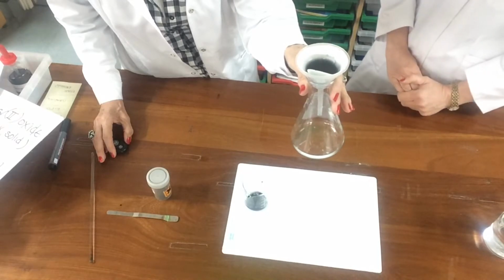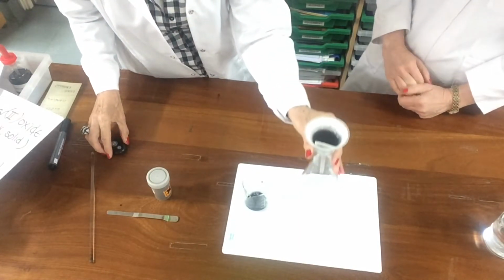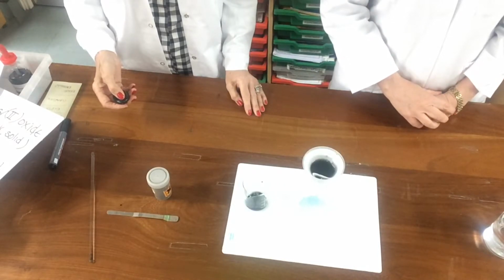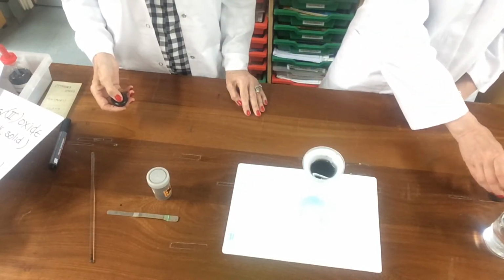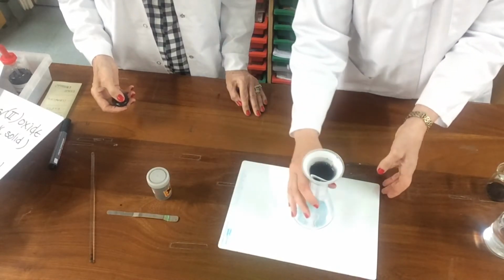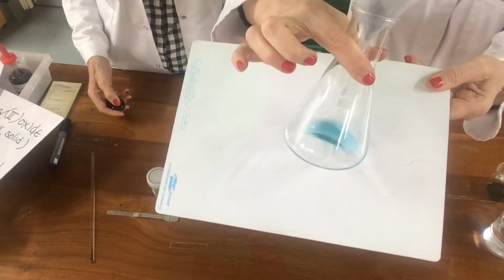So what we've actually done now is we've made the blue copper 2 sulphate solution, and we've removed the excess copper 2 oxide. So the liquid in the bottom of the conical flask is called the filtrate, and the black solid that's collected in the filter paper is called the residue. And I hope that you're beginning to see the blue colour now coming through, just about, I think. Let's hold this up a bit more and you might be able to see it better. Can you see that lovely blue colour there beginning to form?